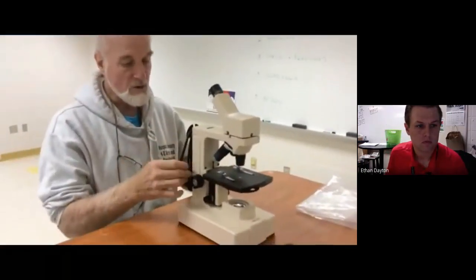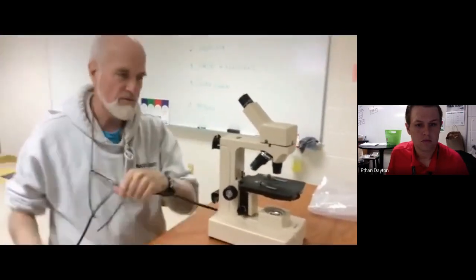You put your case aside. Now it's time to plug your microscope in. So you unwrap your cord gently. You never fling it around.